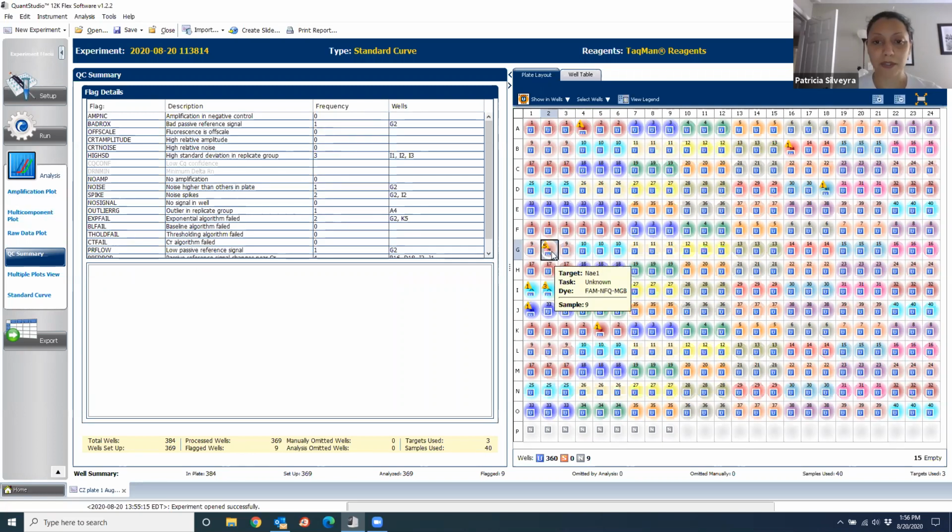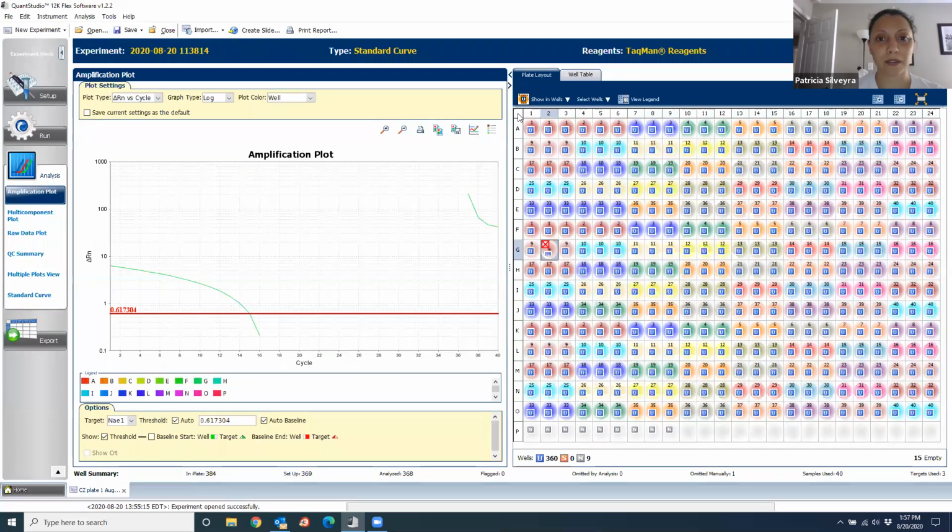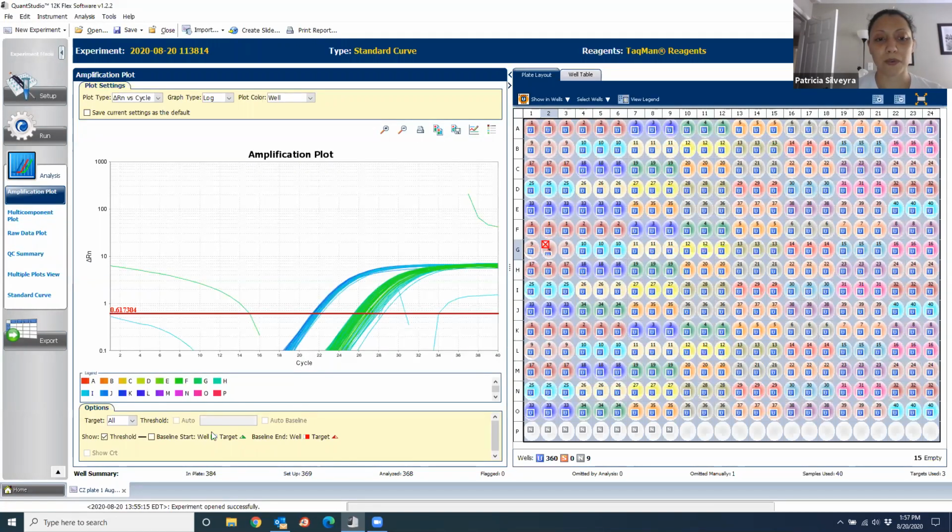So to get rid of that well, you right click with your mouse and you will see this menu, and then it will say omit. You can also do Control M, I think, for omit, and on some computers that works, in others it doesn't. But when you do that, you will see that all of these things disappear now. And if you go back to the amplification plot, you no longer see some of the things that you saw before.